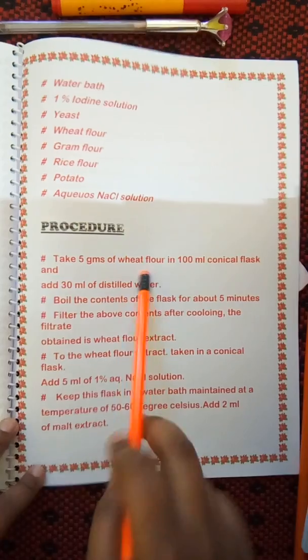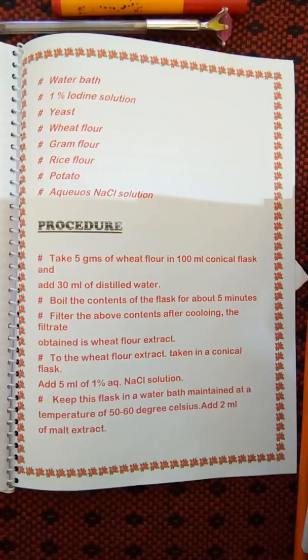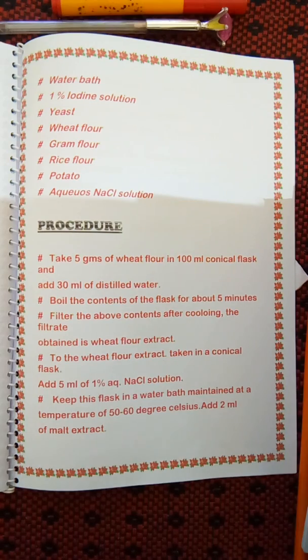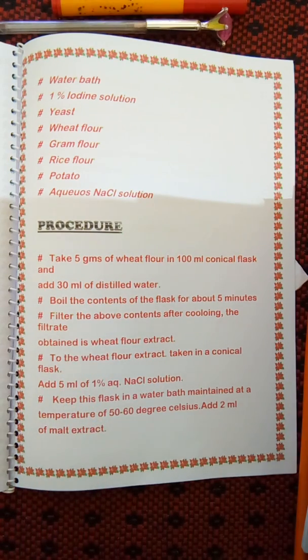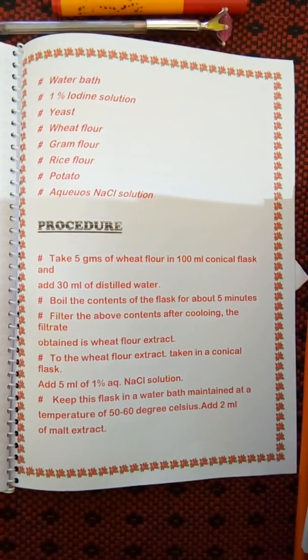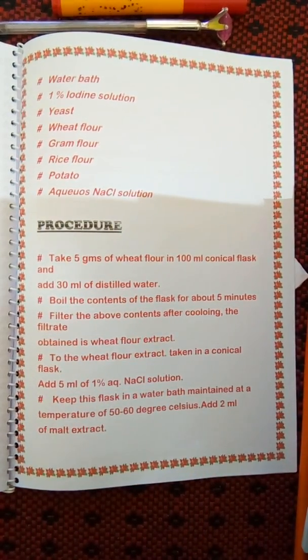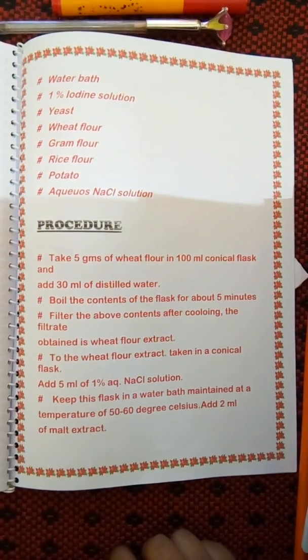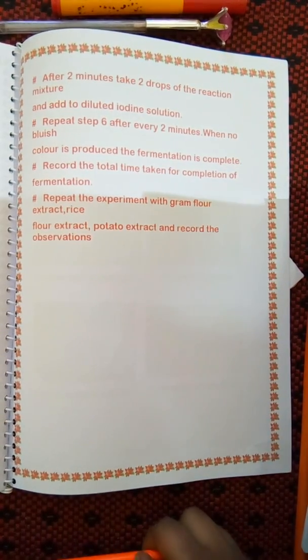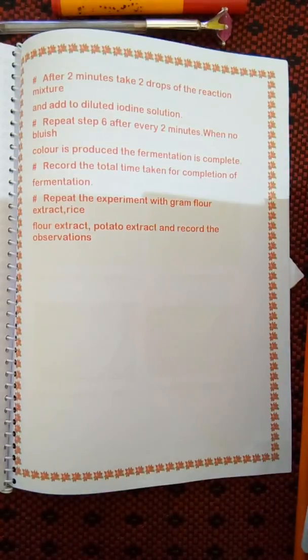In the procedure, we took equal amounts of flour in flasks, added distilled water, boiled the flask, and obtained the flour extract. I also used mashed potato — you can use mashed, pieced, or chopped potato. Then 5 ml of 1% aqueous NaCl was added to all four conical flasks, followed by enzyme diastase. After a few minutes, iodine solution was added. We are testing the point at which the iodine solution's blue-violet color disappears.